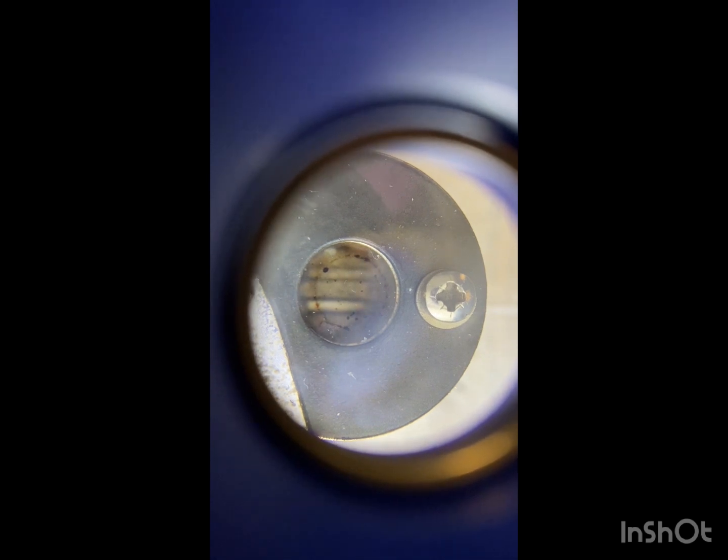There we go. So we'll just watch for it to start melting, and hopefully we'll get a range of 236 to 237.